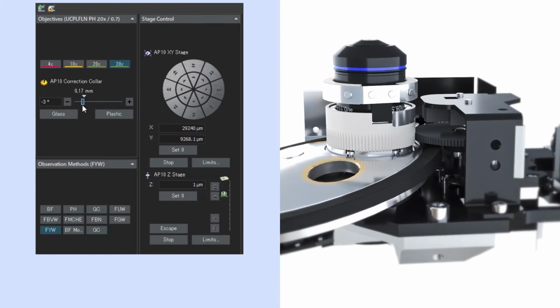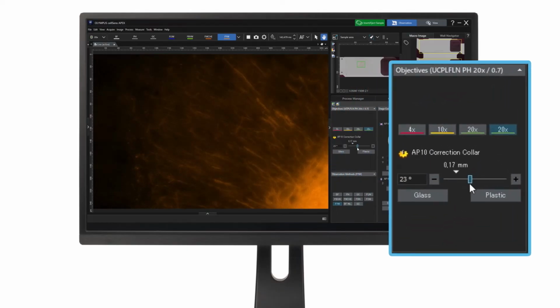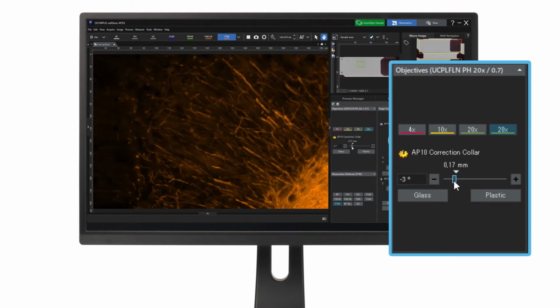When you adjust the correction slider, the blur caused by the spherical aberration is reduced, resulting in a clearer image.